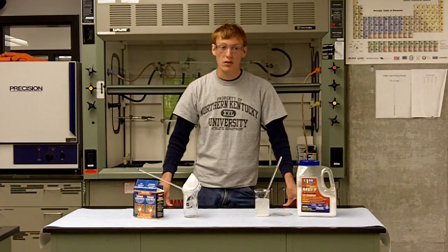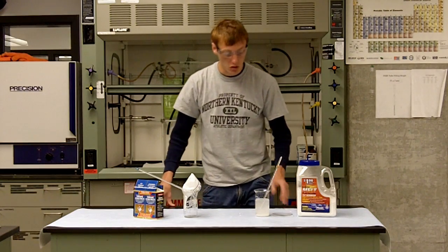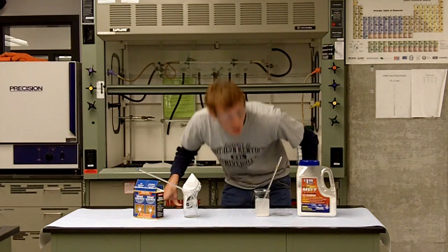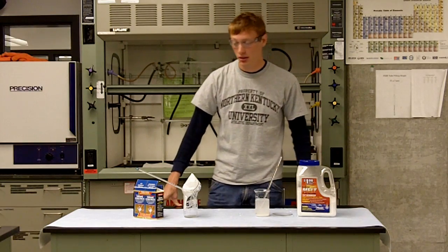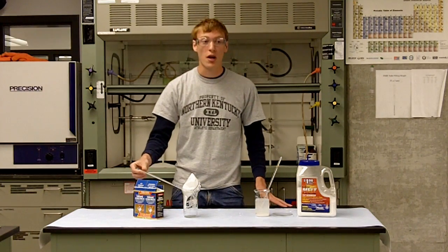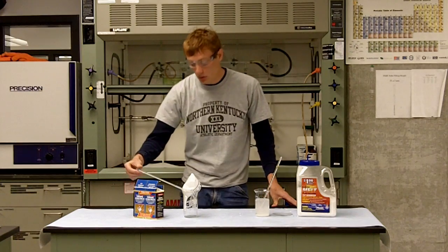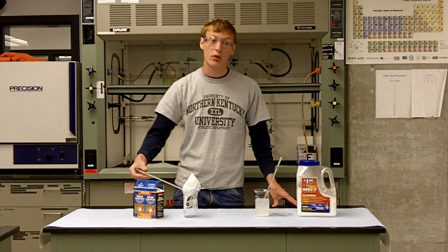After waiting a few minutes, the temperature for the ice melt started at 24 degrees and is now up to 37 degrees Celsius. The cold pack also started at 24 degrees and the temperature is now down to just below 5 degrees.